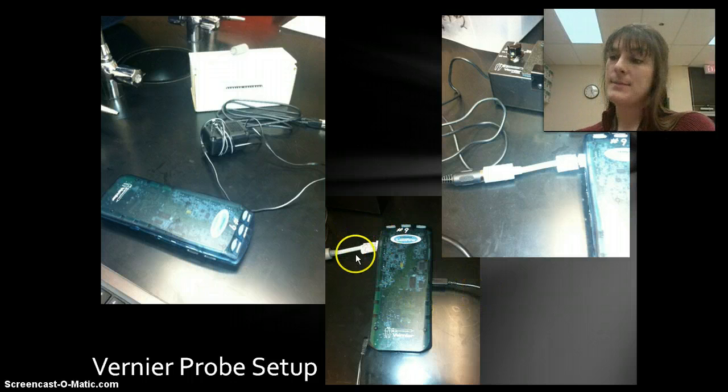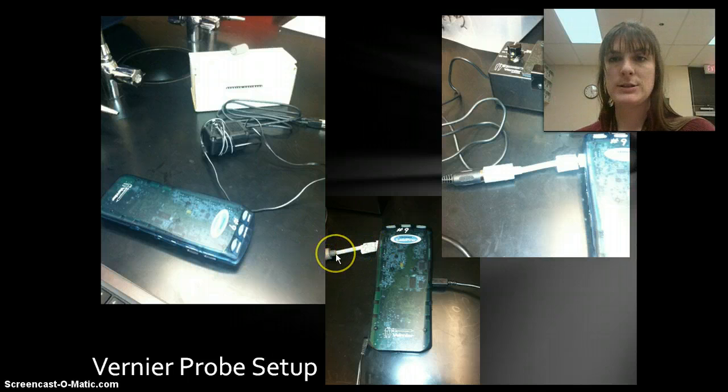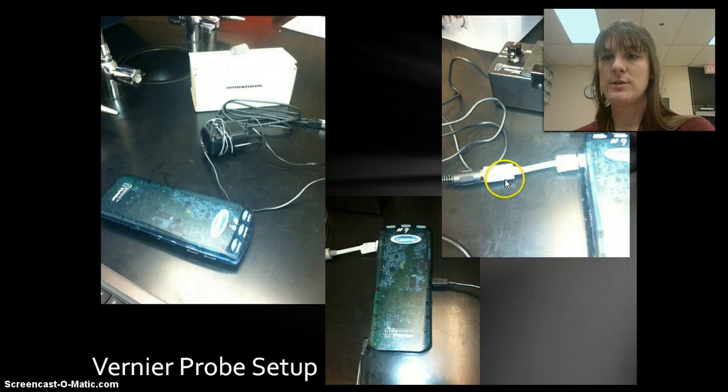And then up on top, there's a couple of different channels. These have 4 different channels. I just like to use channel 1, and you can use that to connect through this little gray connector and then to your probe. So we've got this gray connector, and then it connects to the probe itself. The colorimeter looks like this. I've got this knob up here that I can have different colors of light going through. I have this little door up here. This just swings open and swings back closed so I can put my samples inside of this little machine.